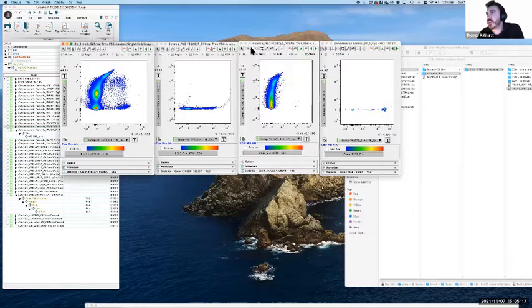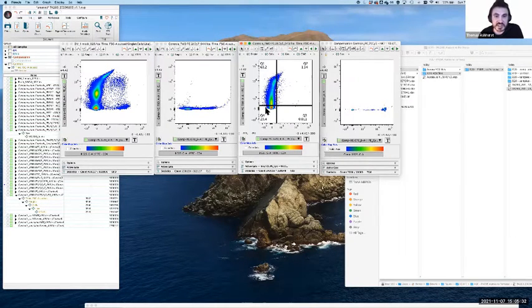What we're seeing here is that with the FMO and with the single stain, you're getting a leaning of this population into the NK1.1 PE-Cy5 detector. Now this can be a problem because the PE-Cy7 signal, in this case Ly6C, is starting to look like it expresses NK1.1. This creates a population which you may miss. If something is super negative, it's kind of obvious. You're like, well, that looks absurd and that can't really be there. Whereas you may well have NK cells expressing high levels of Ly6C.